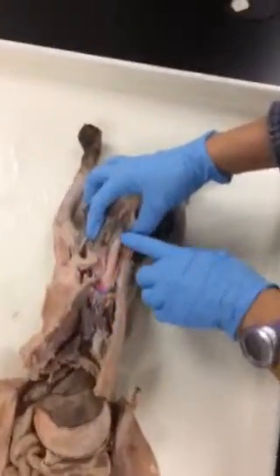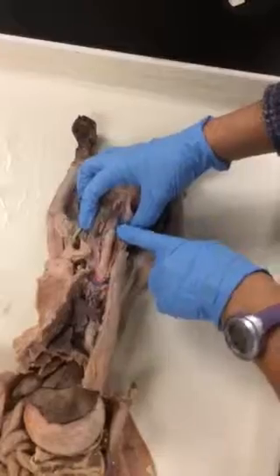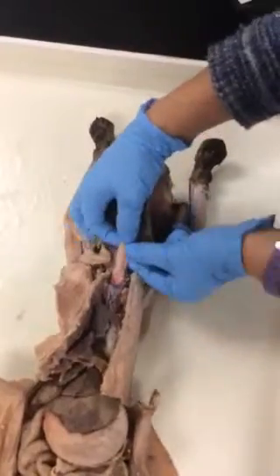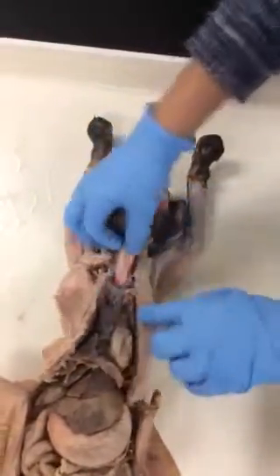Okay, here on the cat, we're looking right now at the larynx. I'm not doing the details of the exam on the cat; we have the details on our model. We have the trachea, and posterior to the trachea, visible here, is the esophagus, almost still attached in this case.